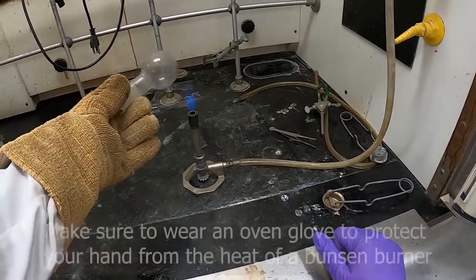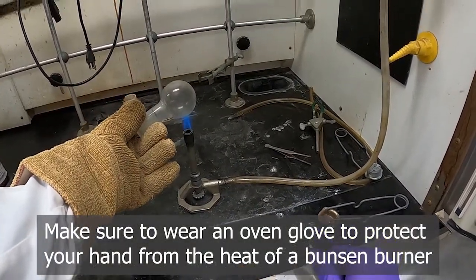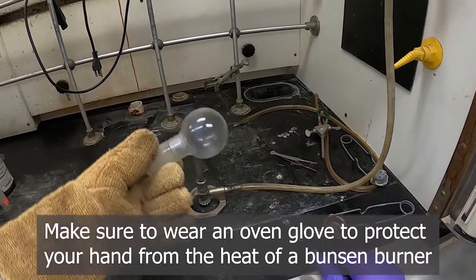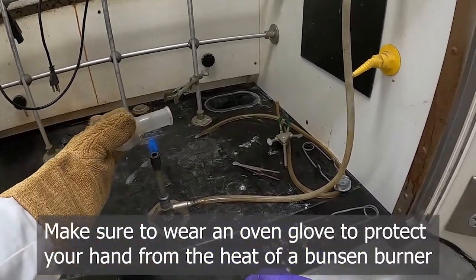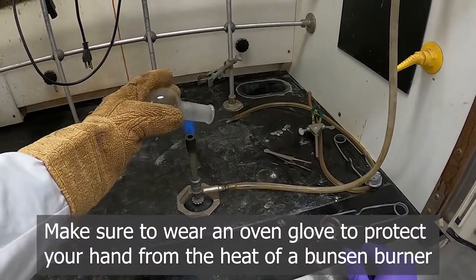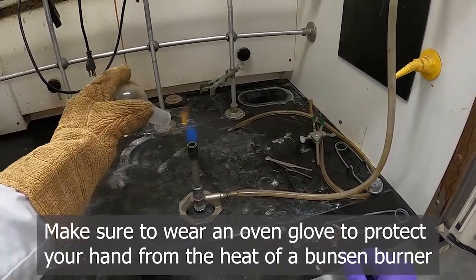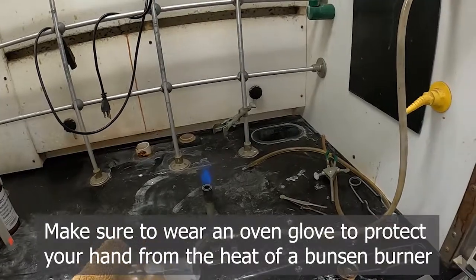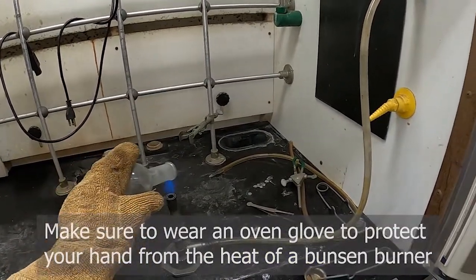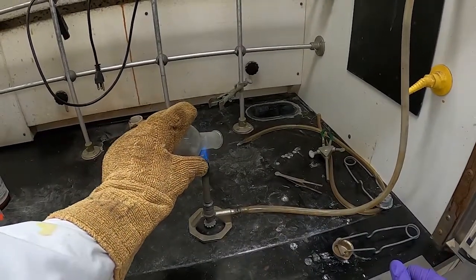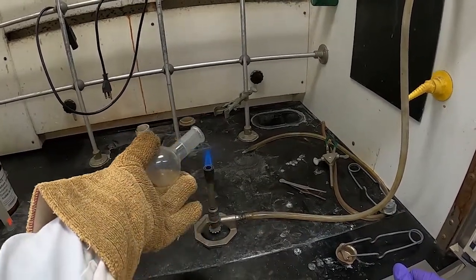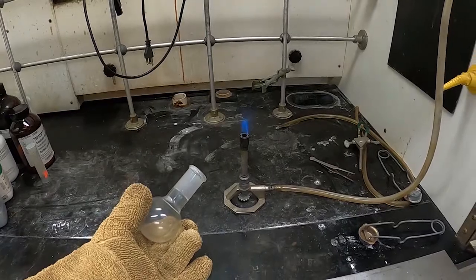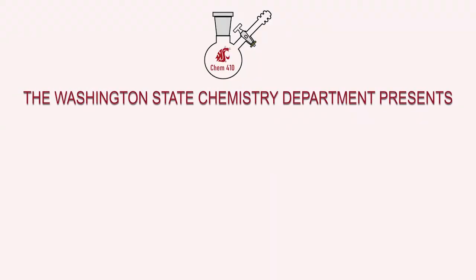And it's important to wear some kind of protective glove while doing this so that you can safely handle the piece of glassware around the flame, carefully though, without lighting your glove on fire.